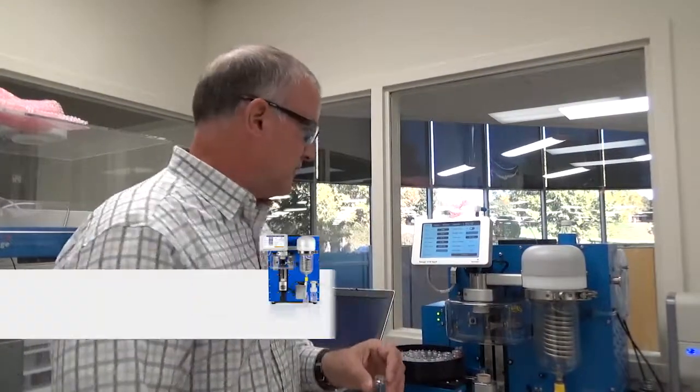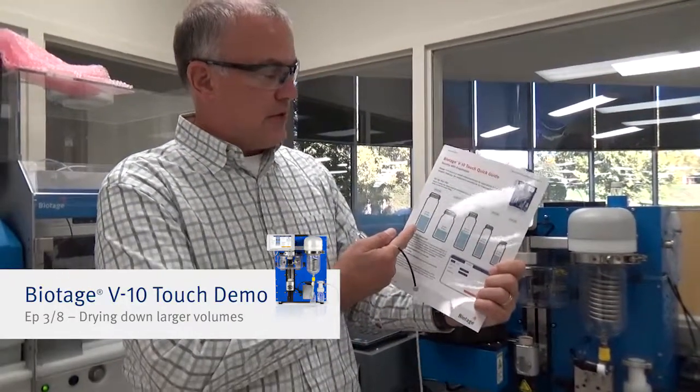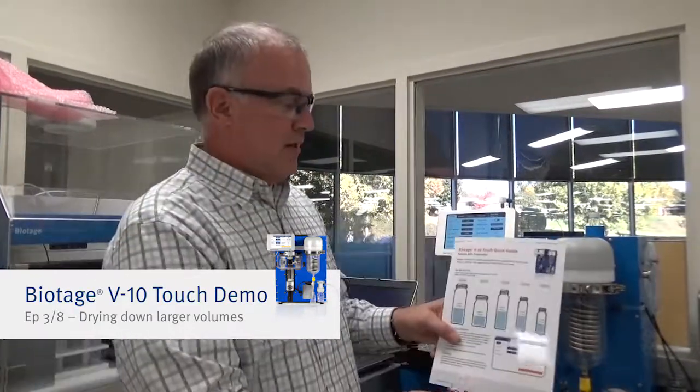One of the things about the V10 is we're limited on the vial size. We looked at this card earlier and you can use up to a 30 mil vial and you can go all the way down to a 4 mil vial. But we're going to use this 20 mil vial again.